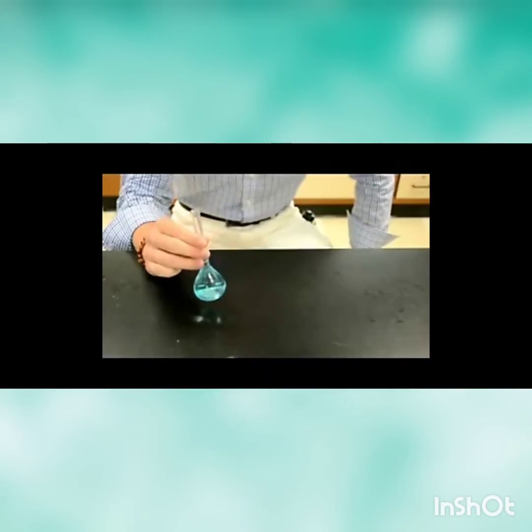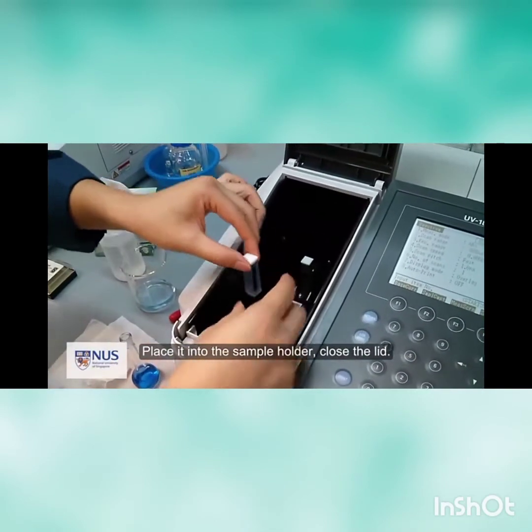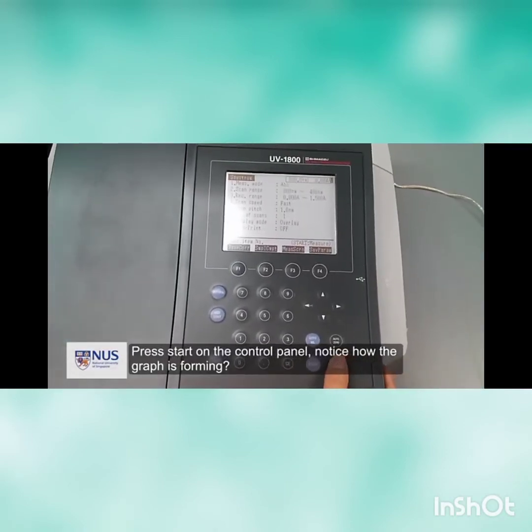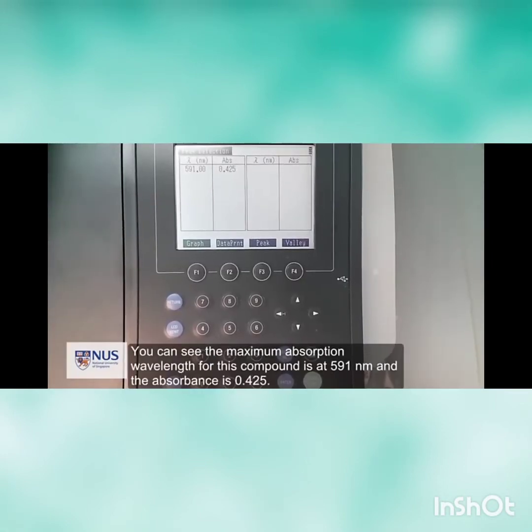The color of the unknown solution must not be darker than the most concentrated standard solution. Then, analyze the sample by using the spectroscopy instrument. From the analysis, record the maximum absorbance and the wavelength value of each solution into a table to construct the graph.